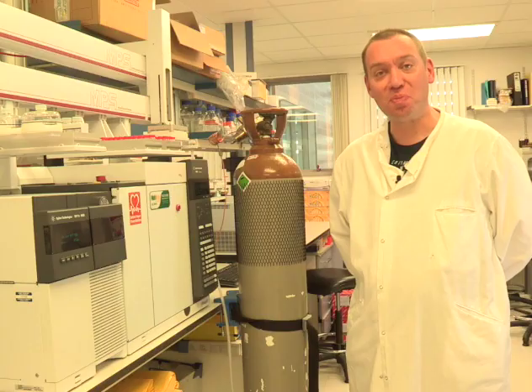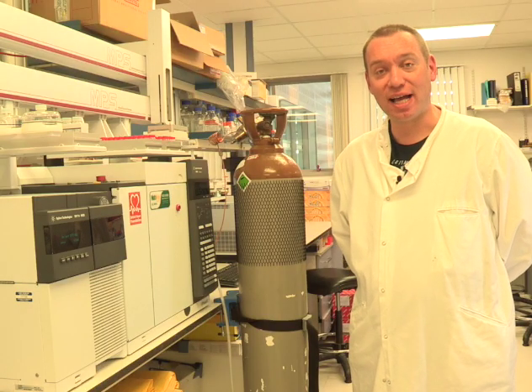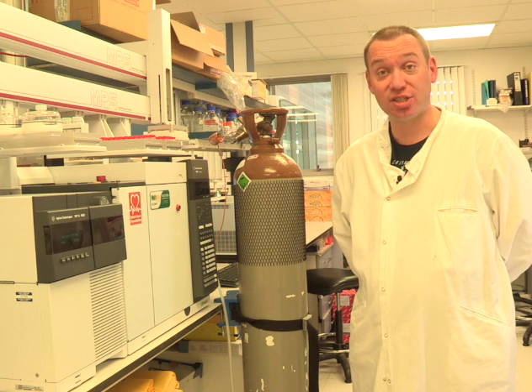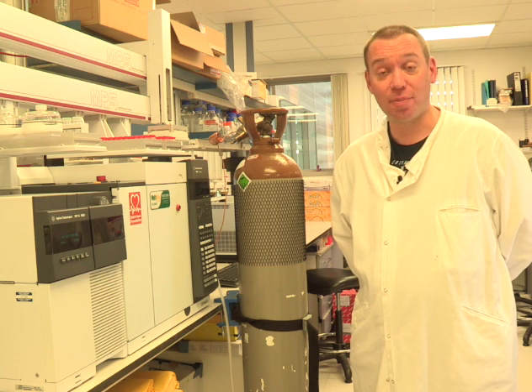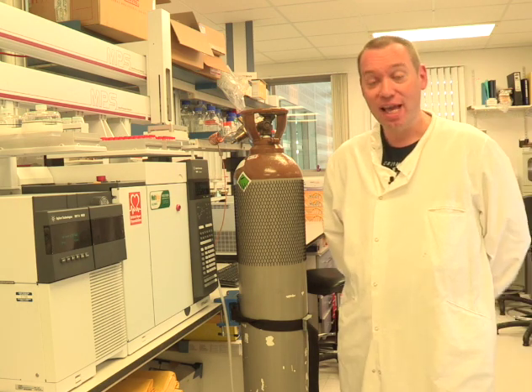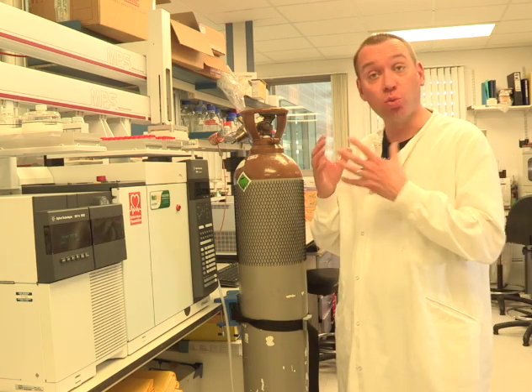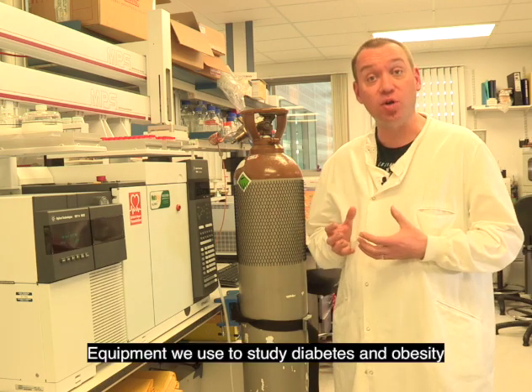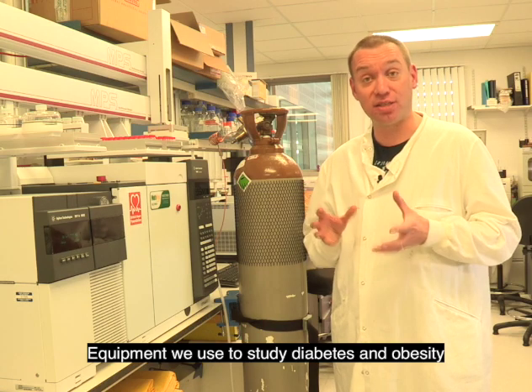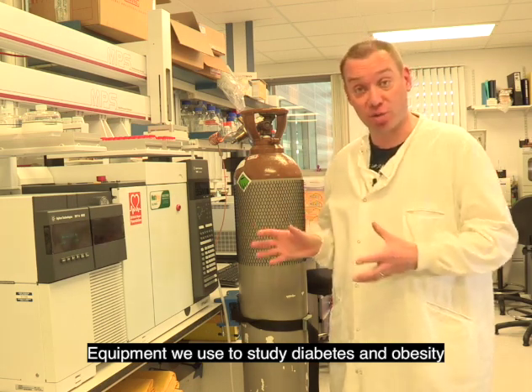Hi, my name is Sam Virtue and I'm a senior postdoc working in the Institute of Metabolic Sciences at the University of Cambridge. What I'm going to do today is show you one of the pieces of equipment we use to study diabetes and obesity — this machine is a mass spectrometer.